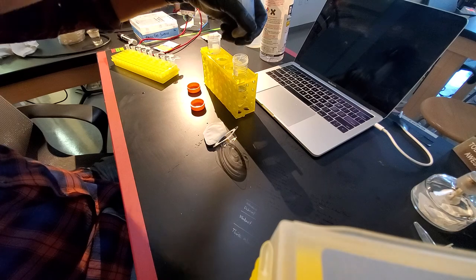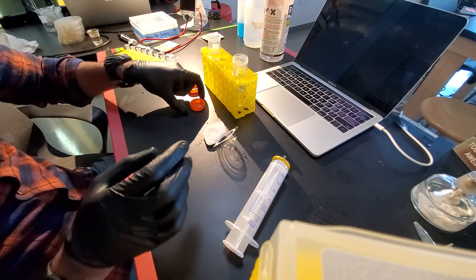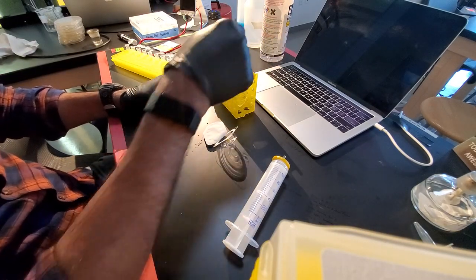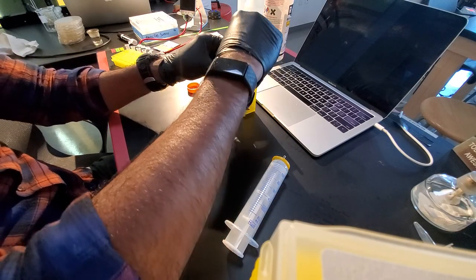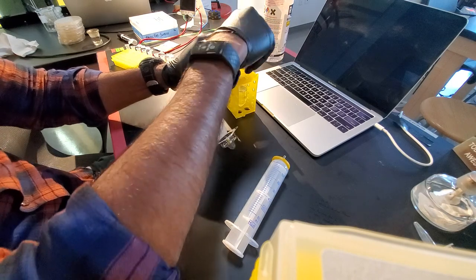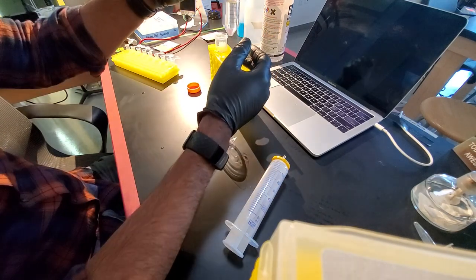Okay, there we go. We're done. I don't care about this anymore. Again, I'm going to be really careful not to touch the tip of this or the inside tip of this. And now I have my filter sterilized solution in this.